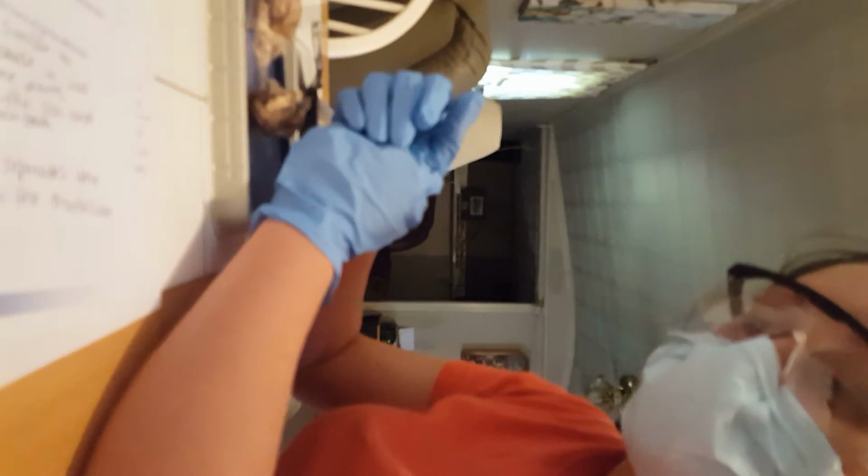Then I'm going to push this away. And the first question is, how does the sheep brain compare to the human brain? Name at least two differences. I wrote that the sheep brain is similar to the human brain because it has almost all of the same parts. Two differences would be the size and the direction of the brainstem. And the second question is, what two lobes does the central sulcus separate? I wrote, the central sulcus separates the parietal lobe from the frontal lobe.